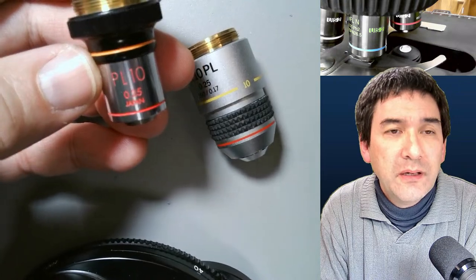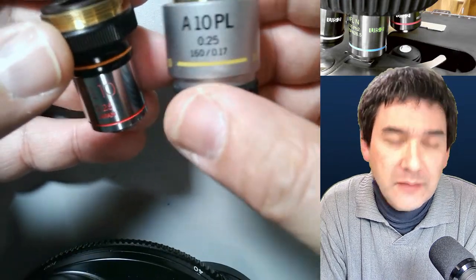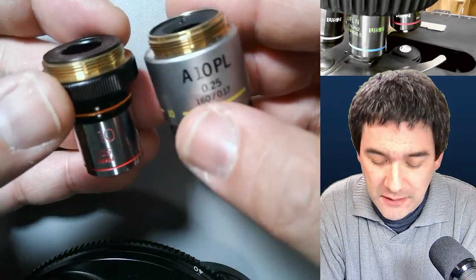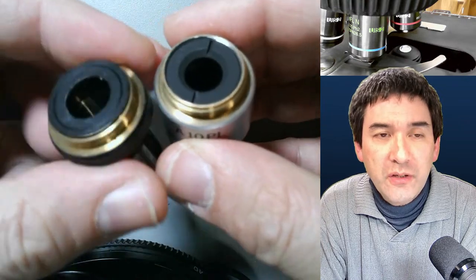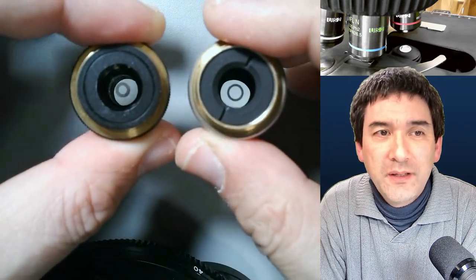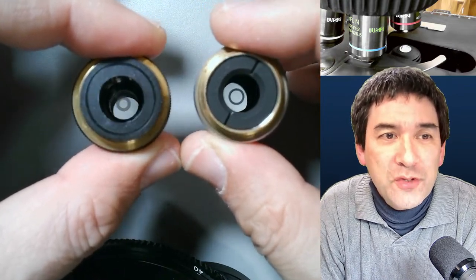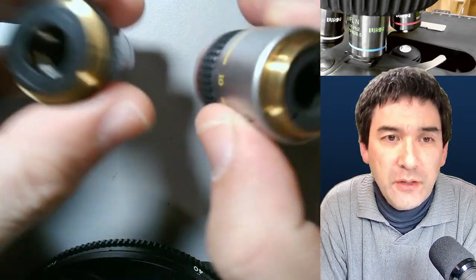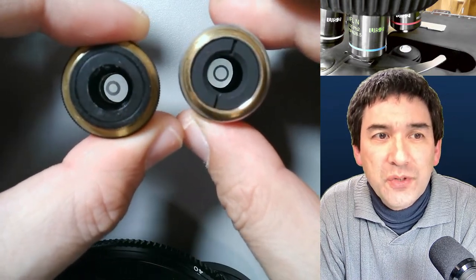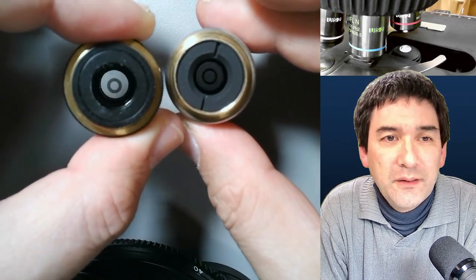Both of these are 10x objectives. This one says 'PL' — PL stands for Positive Low. You can see there's a significant size difference between them. These are two different standards: one is a short-barrel older system, the other a slightly more modern system. If you take the objectives out and look from the back, you can see the phase ring inside — that's how you identify a phase contrast objective.